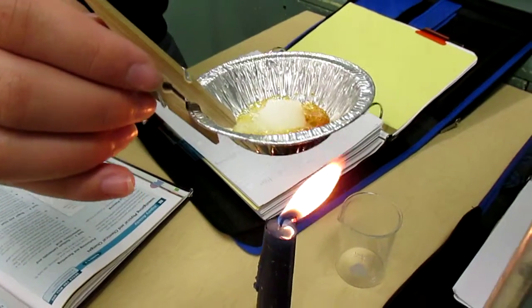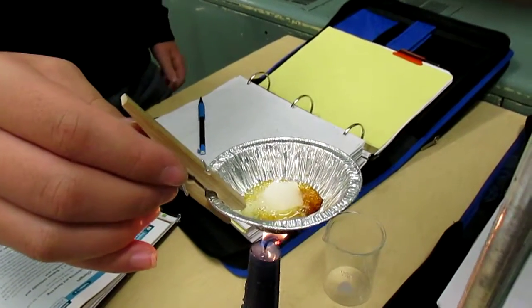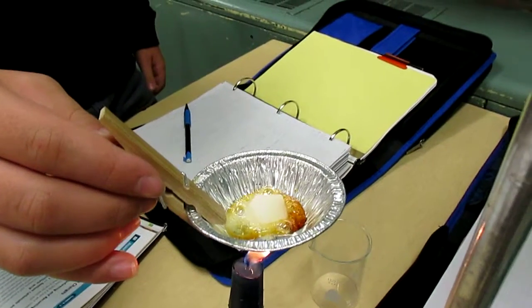It's like melting or shrinking into yellow goo almost. And that's boiling. Now it's boiling? Yeah.